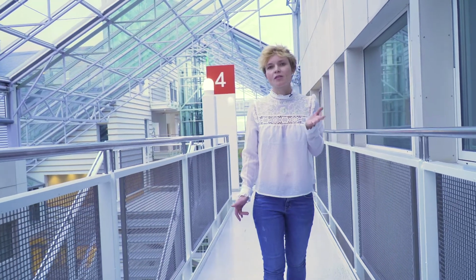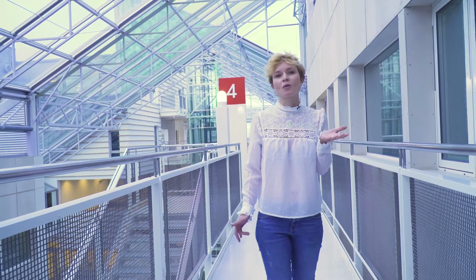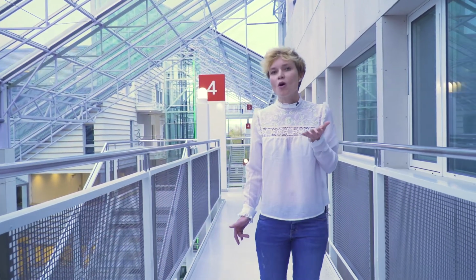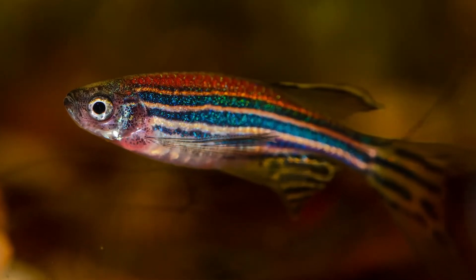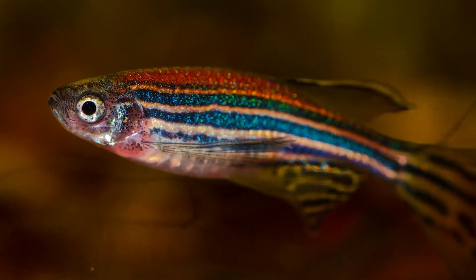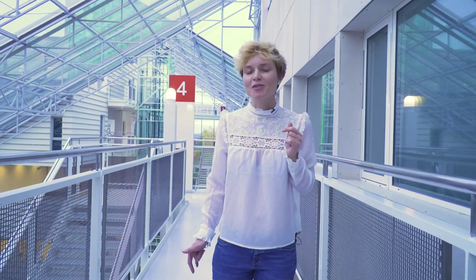Historically, this is a much shorter time compared to using mice or fruit flies in research. But the zebrafish, with its external fertilization, has really allowed us to learn lots of information when it comes to the early stages of development, namely fertilization. Additionally, because of its small size, it's been very useful in chemical screens. Today, Anna and Nancy are going to give us a tour of the zebrafish facility at Forskningsparken here in Oslo.